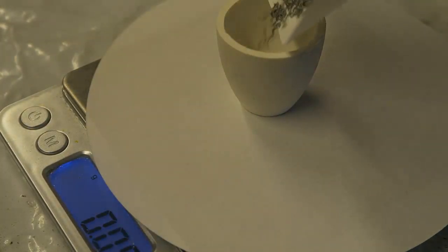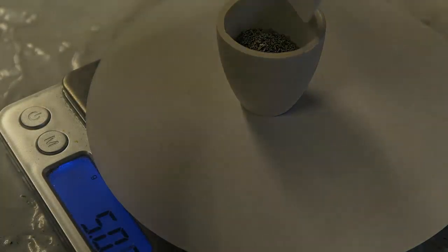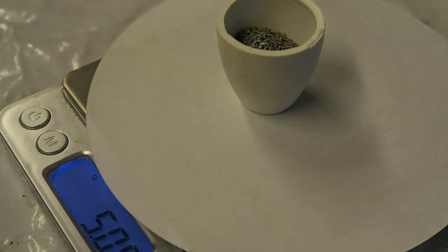5% is actually quite low and other members got even lower percentages to work, but with 5% I think you're good to go.